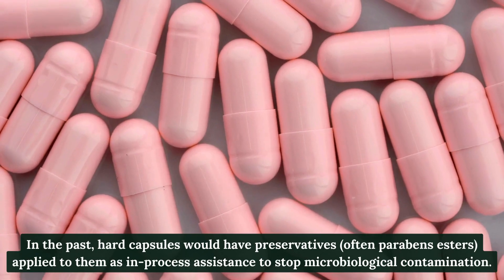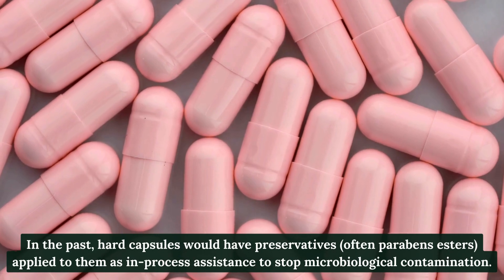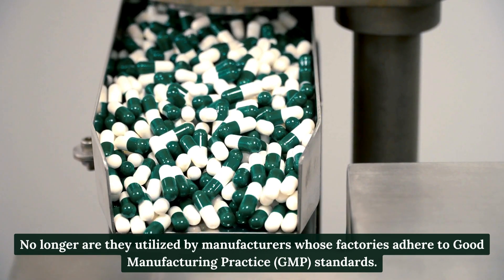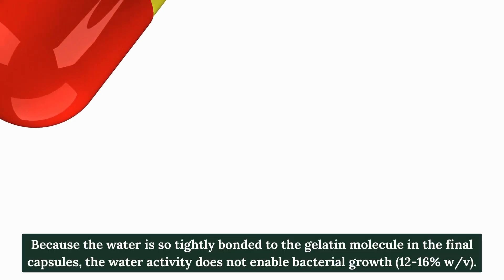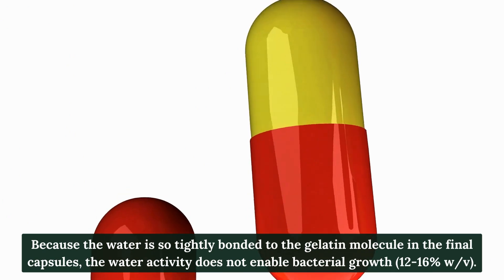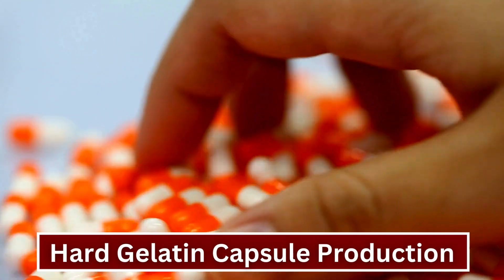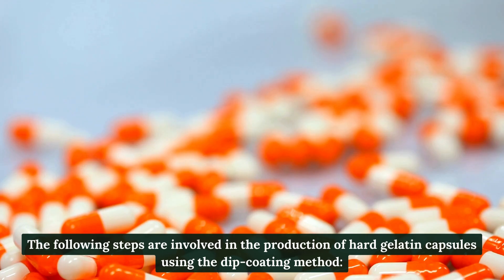Opaque capsules can be used to hide contents or shield them from light. In the past, hard capsules would have preservatives — often parabens esters — applied as in-process assistance to stop microbiological contamination. These are no longer utilized by manufacturers whose factories adhere to Good Manufacturing Practice (GMP) standards, because water is so tightly bonded to the gelatin molecule that water activity does not enable bacterial growth. Water content is 12 to 16 percent.